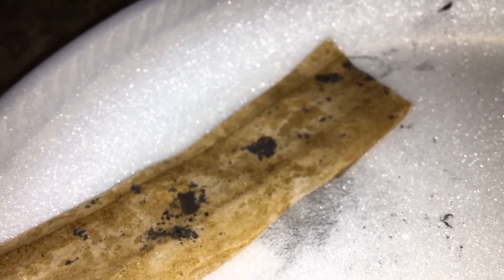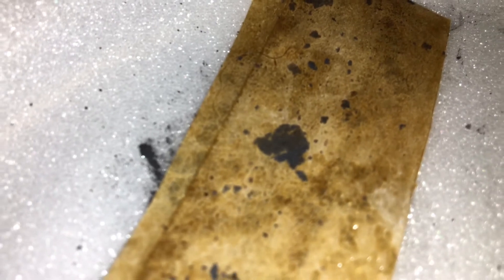If you're able to cleave as much as you can, you can in theory put graphite on top of a sugar surface with sugar and then cleave it until there are only a few layers or one layer of graphene left. Then you add your peroxide to dissolve the sugar and you're left with graphene.